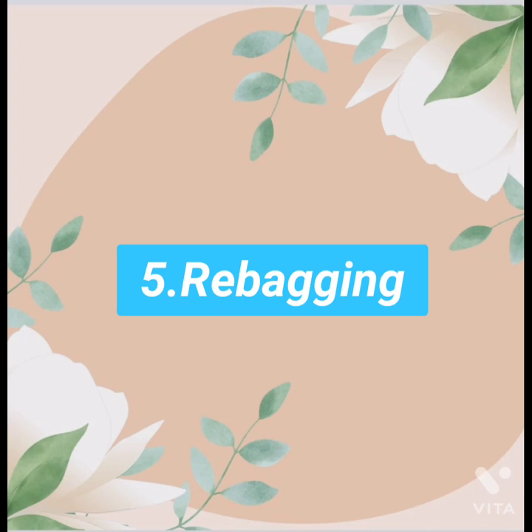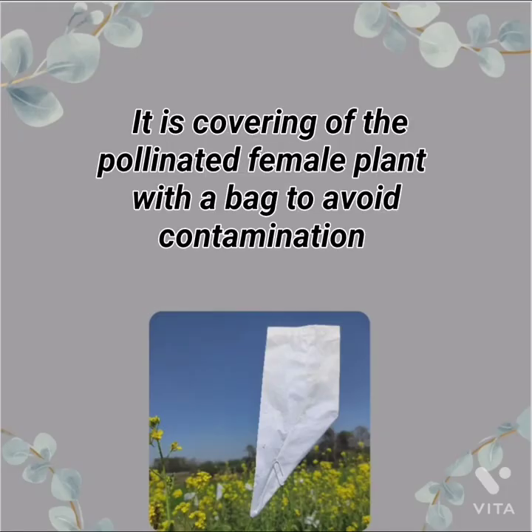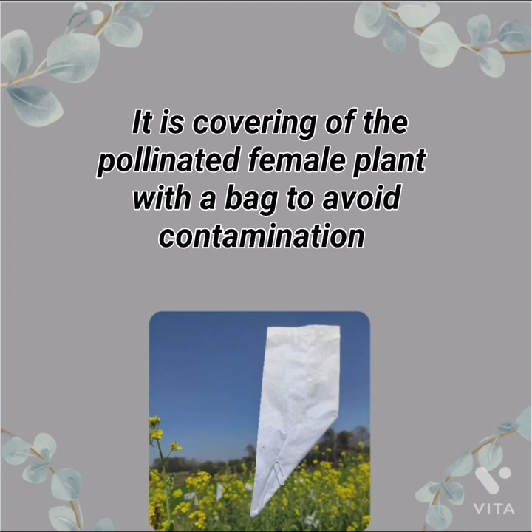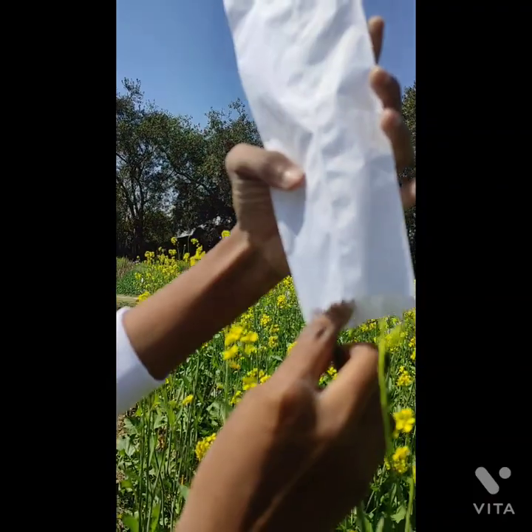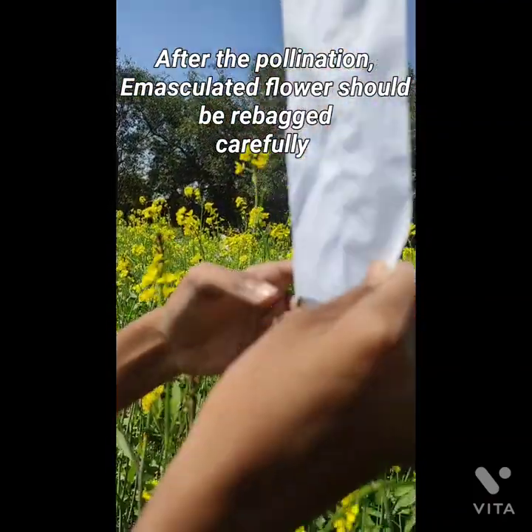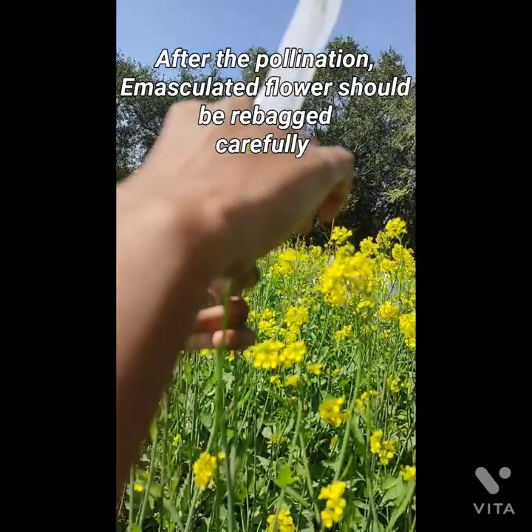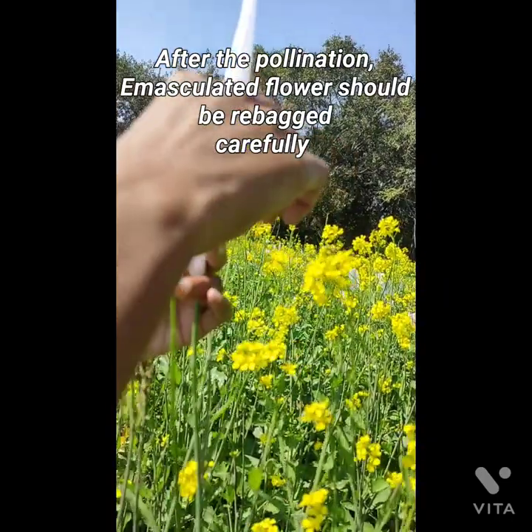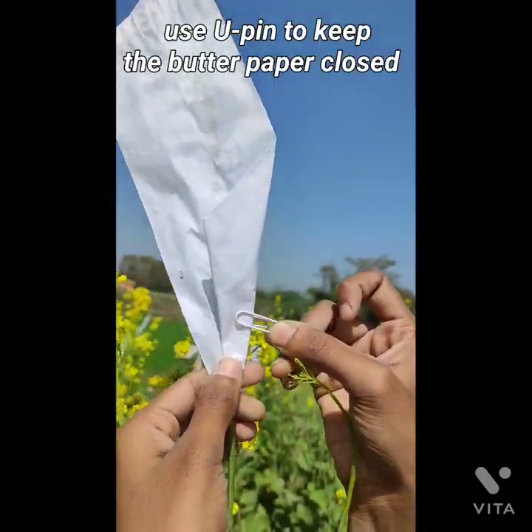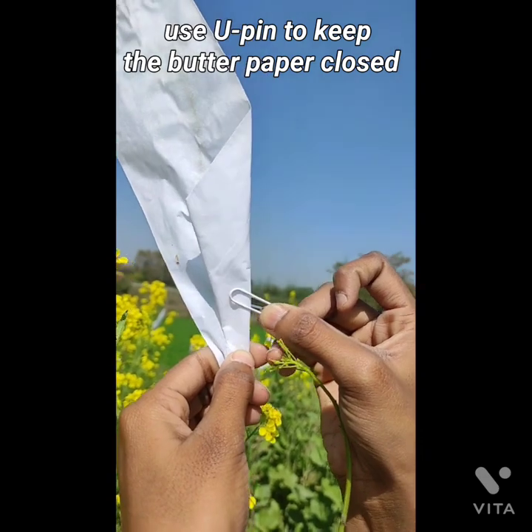The next step is re-bagging. Definition of re-bagging: it is the covering of the pollinated female plant with a bag to avoid contamination after pollination. The emasculated flower should be re-bagged carefully. A U-pin is used to keep the butter paper closed, the same as in bagging.